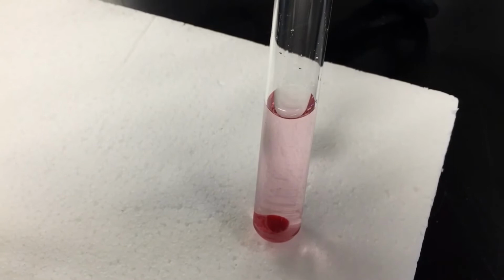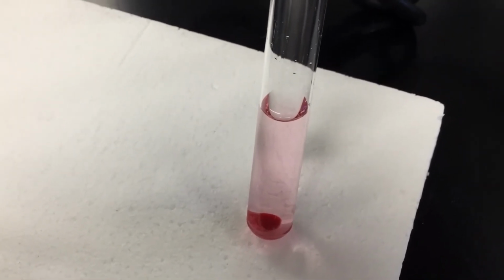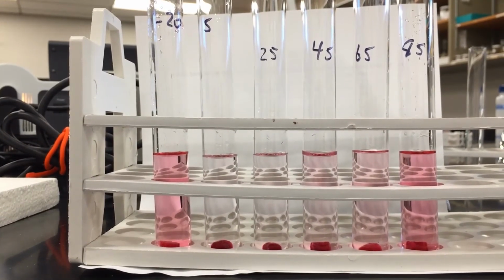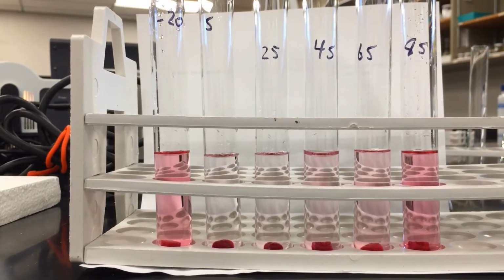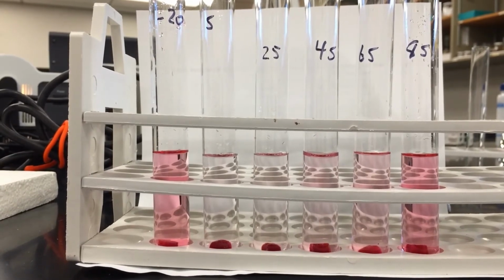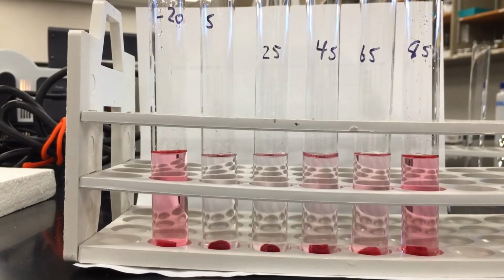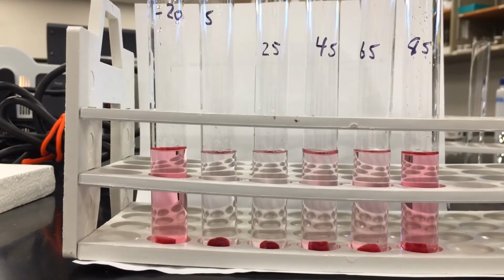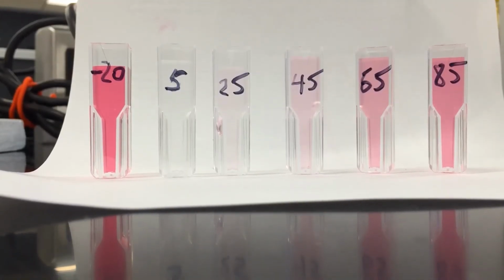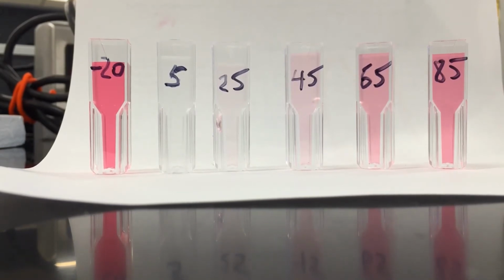So I'm going to take a break now, and I'm going to do all the other samples, and then we'll take a look at the whole batch of them together. So there's the rest of the experiment completed. You can see I have all the temperatures done. They were all conducted the same way the 65 degrees Celsius was done, so they were subjected to each particular temperature for 2 minutes, and then allowed to extract the beta-cyanin for 15 minutes with vortexing in water in each of these test tubes. So there's our solutions from the temperature stress test, and I've poured them into the cuvettes, so you can see there's definitely a little bit of a pattern there.